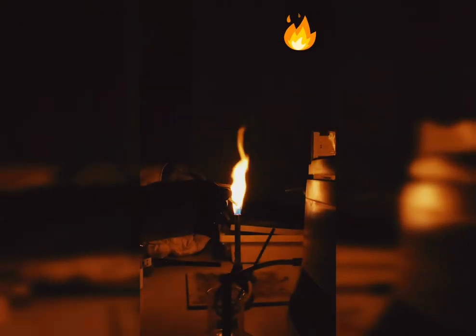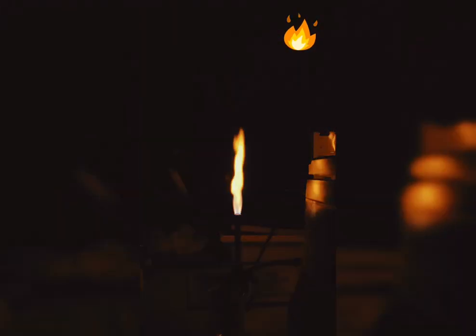Again, we can just show it to you. Sodium is quite bright, but potassium a bit less. And when we add both together, there is more light.